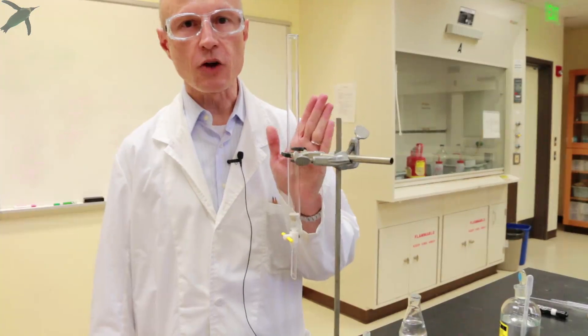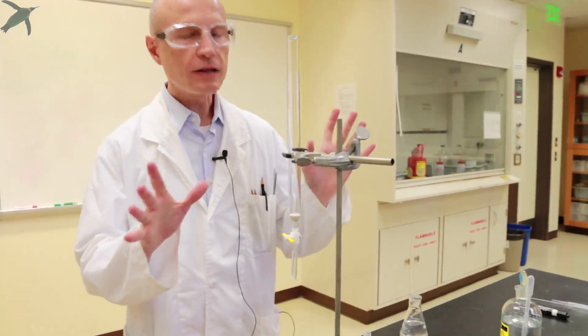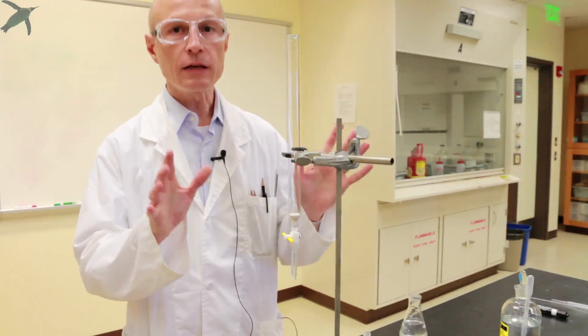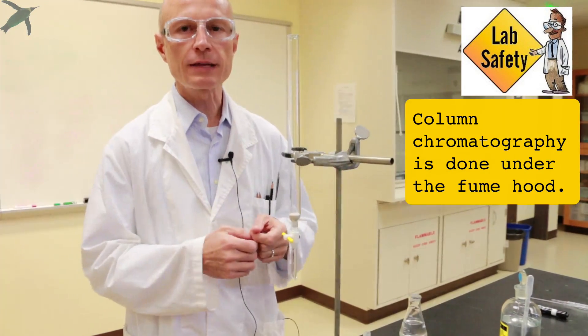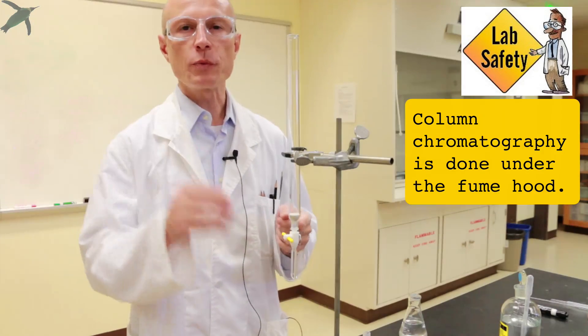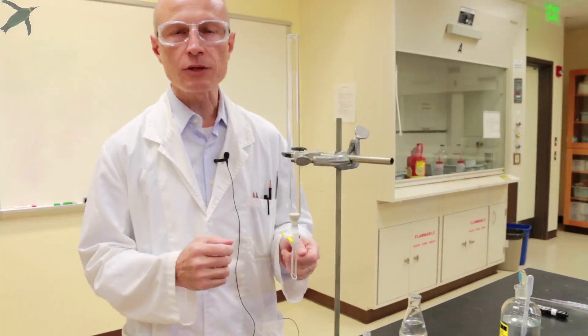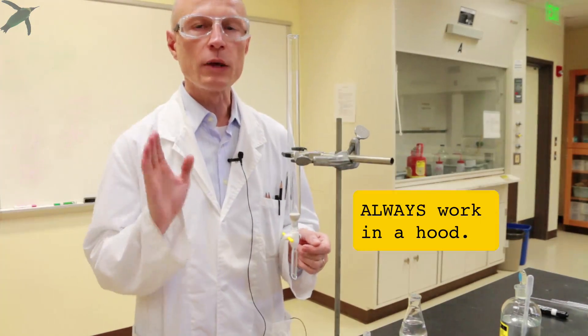Today we are talking about column chromatography. Everything we are doing should be done in a hood because you are using volatile organic solvents. For video purposes we are doing it on the benchtop, but remember always work in a hood.